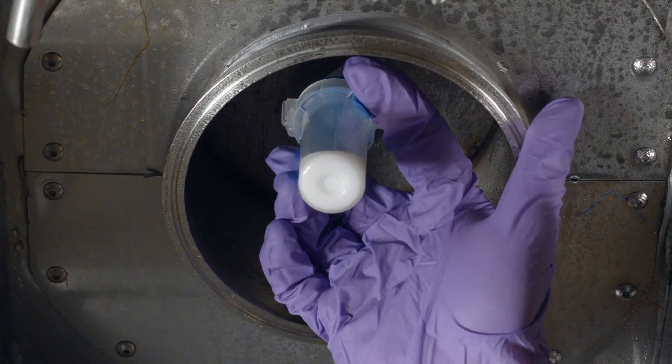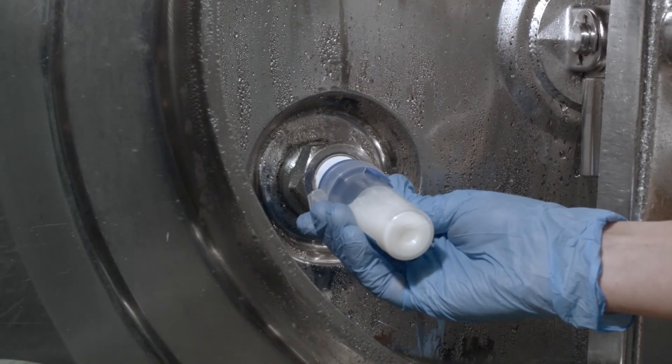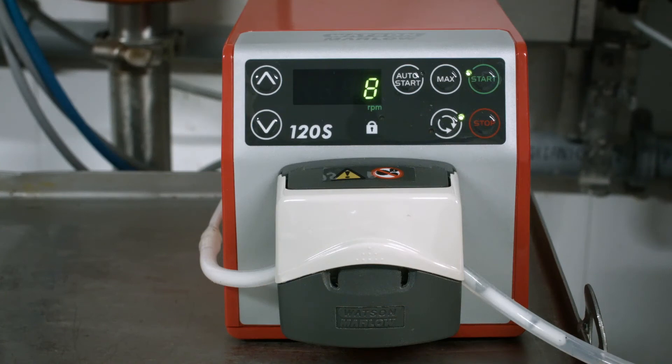Once the needle has been inserted, the liquid will flow into your collection unit. For gathering samples over a period of time, a peristaltic pump is recommended.